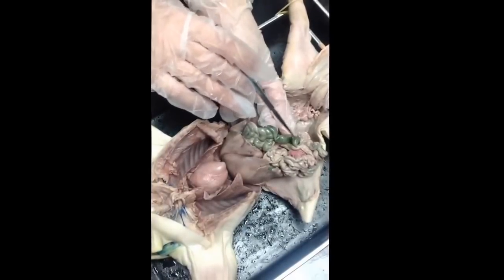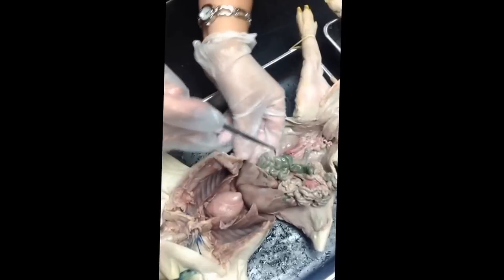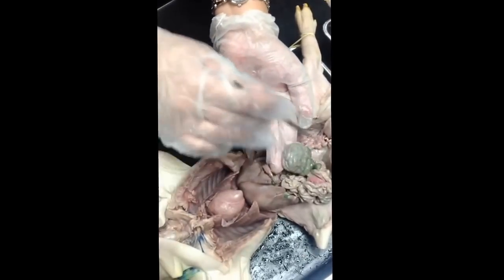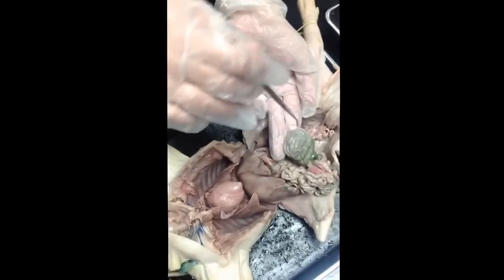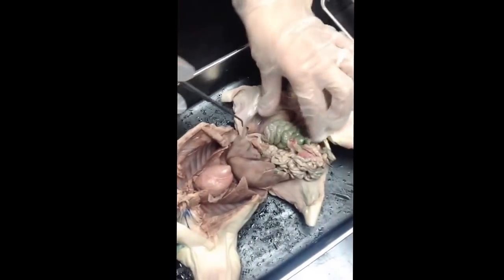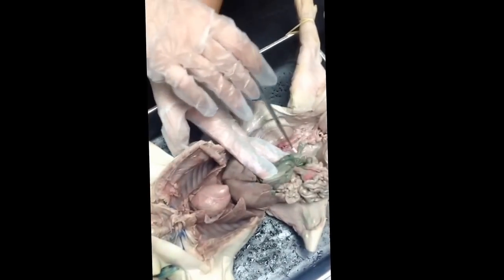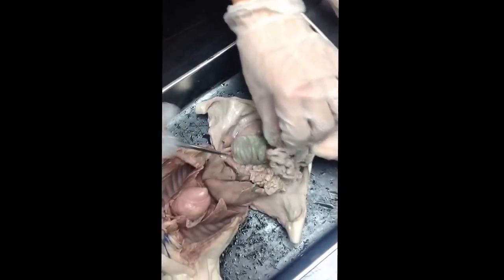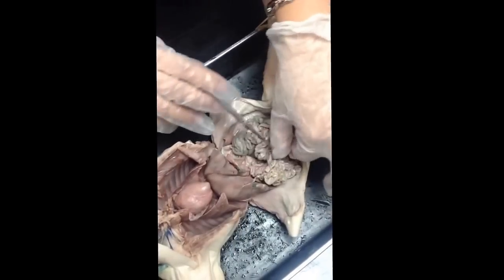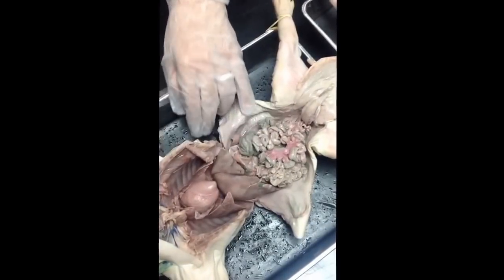The first portion of the large intestine is this pouch called the cecum. It then leads the fecal matter to a spiral colon. I tend to do this hand motion where I go round and round because it's a spiral colon. But students always tell me it's a circle colon. It's like, no, spiral. Then a descending colon and out the body. Okay, now to keep all these things together, you have membranes that have a lot of blood vessels on them. So these are the mesenteries.